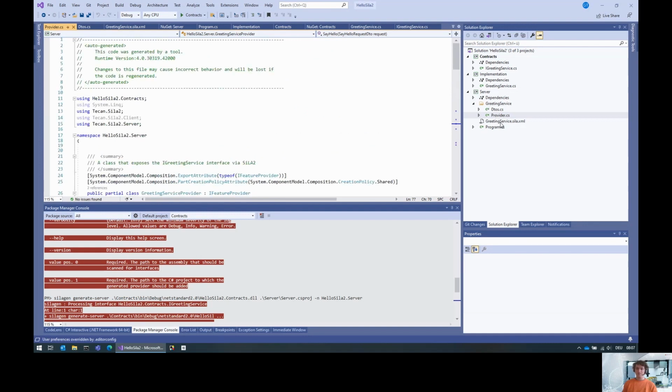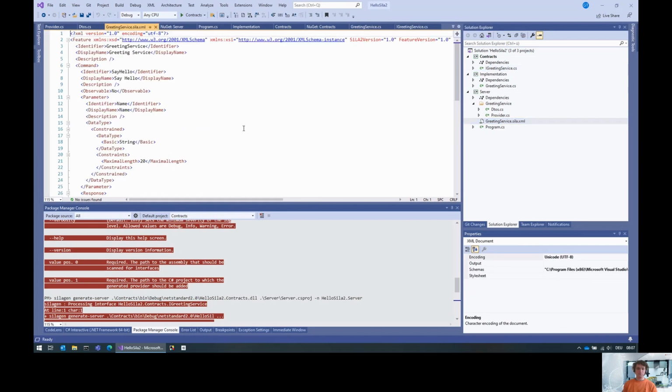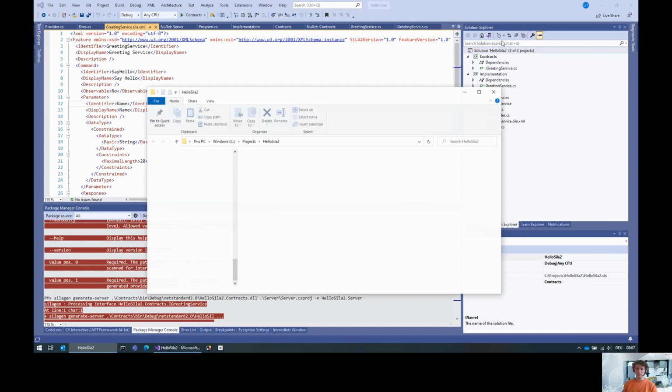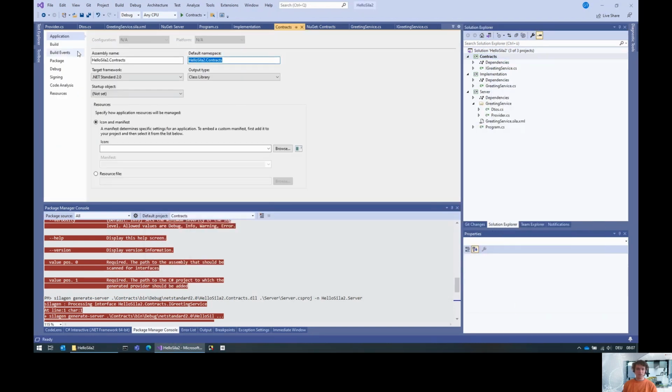Then you notice that there is documentation here, but the generated feature doesn't have any documentation. Wouldn't it be useful to pick up the documentation? And the answer is yes, of course. The only problem that we have now is: is the documentation even generated? Check.